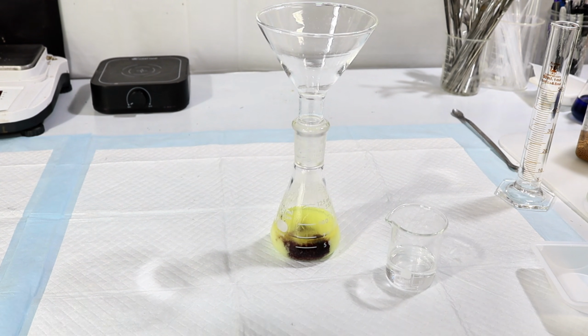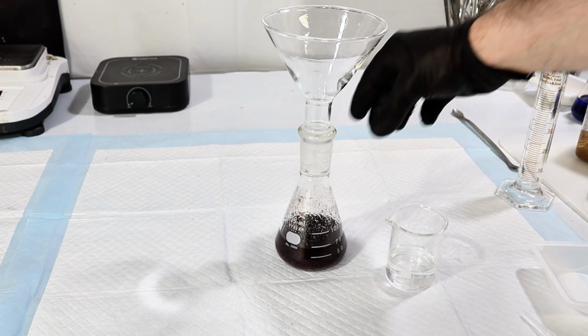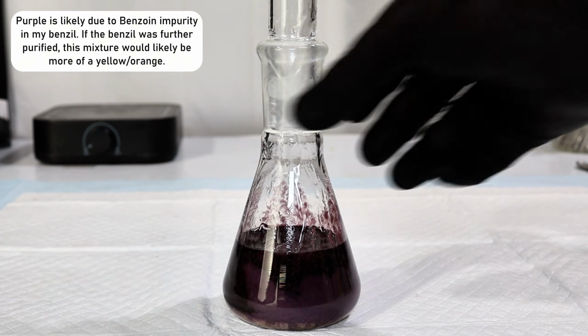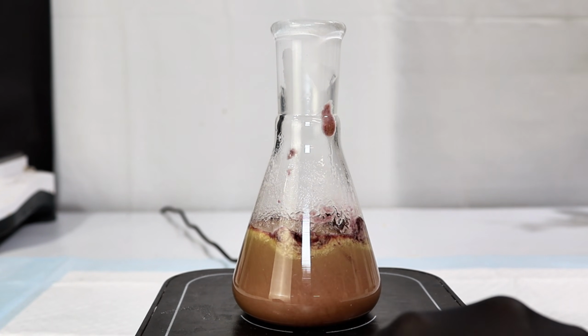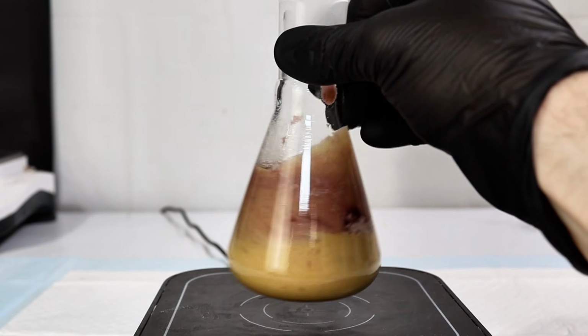This is due to the benzoin impurity in my Benzil, and if your Benzil is 100% pure, you probably won't see any purple color. Anyway, after I'd finished adding all of the sodium hydroxide, I transferred the mixture to a stir plate and stirred the mixture aggressively for a few minutes. During this step, the purple color disappears and the mixture becomes a cloudy yellowish color as the reaction begins.